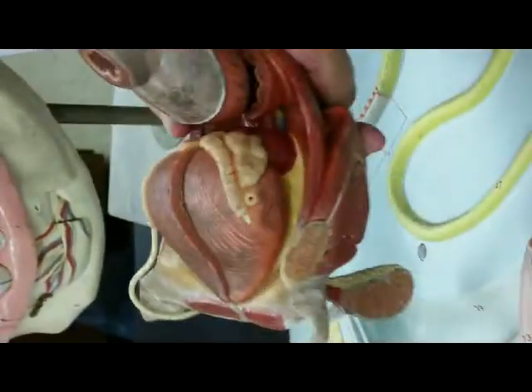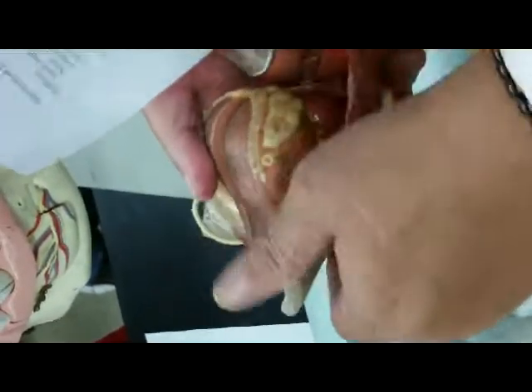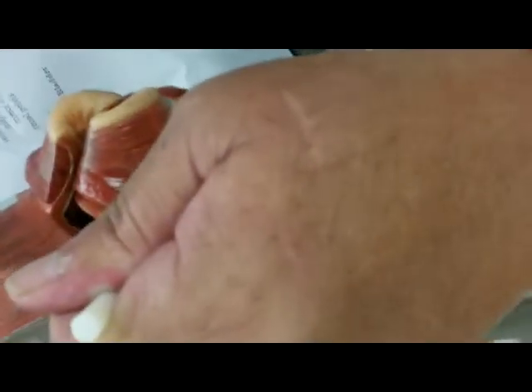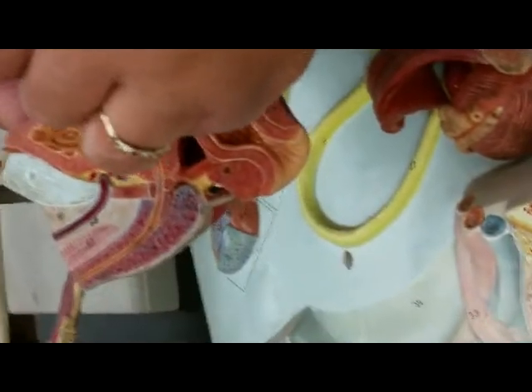This is the urinary bladder. You're seeing the same thing. Seminal vesicle. This is the vas deferens, spermatic cord, the testis, the epididymis. And now this would be hidden inside. Not going to open it yet. Location is important. What is that? Prostate gland. Prostate gland hidden in there. Same thing you're seeing there. And so now we open it. Urinary bladder, prostate gland. Here is the prostatic urethra, the membranous urethra right there.